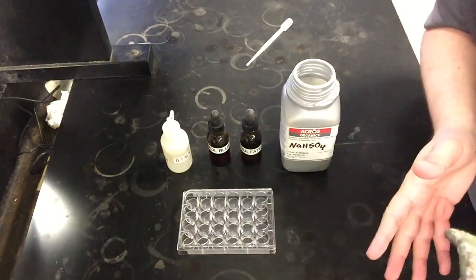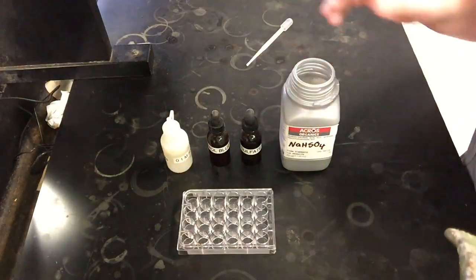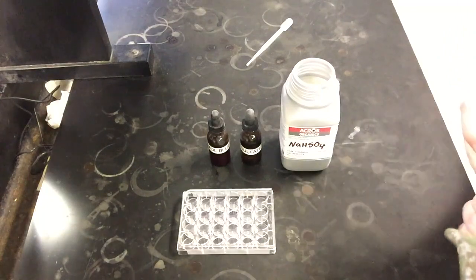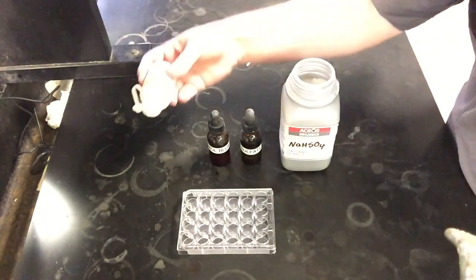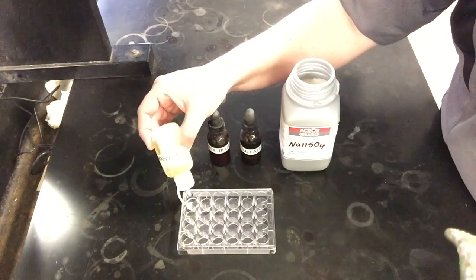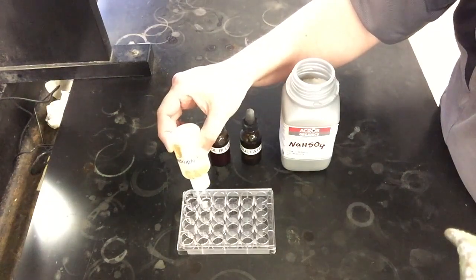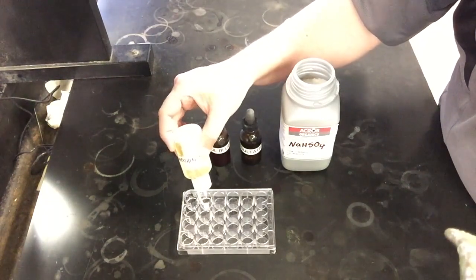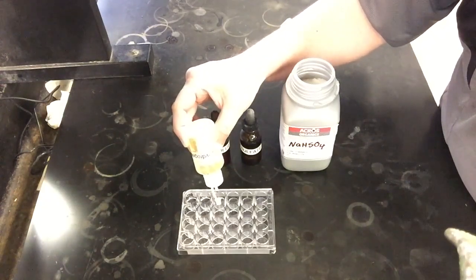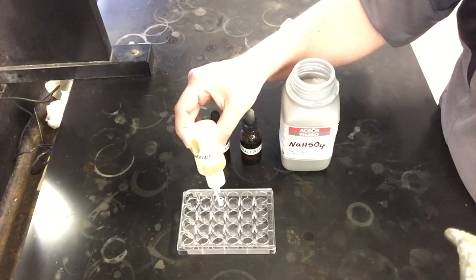All right, so for the first reaction, we're going to take a look at the dissolution of sodium hydrogen sulfate. We already have a solution of it pre-made that we're going to start with, so I'm going to add this quickly to a few of the wells on our well plate here. Again, our goal as we make our observations is to see how things change. Most likely it's going to be a lightening and darkening of colors. Most of the time it might not be a huge color change. Sometimes it might be, and it's really obvious. So we just want to pay very close attention and try to make good observations as we watch them.